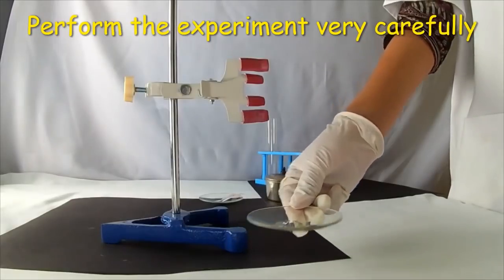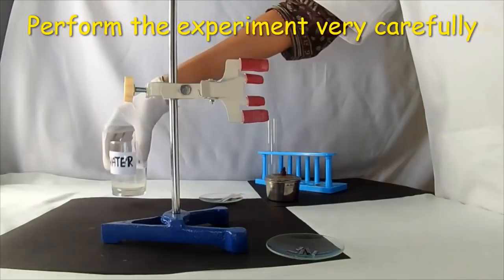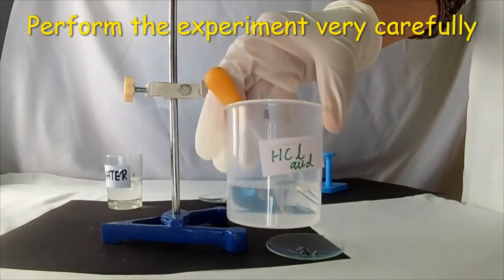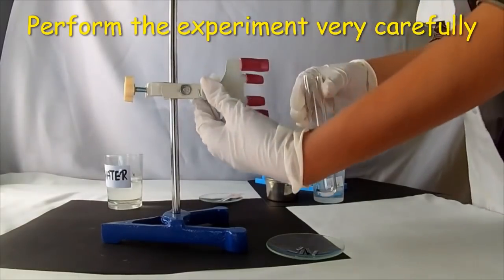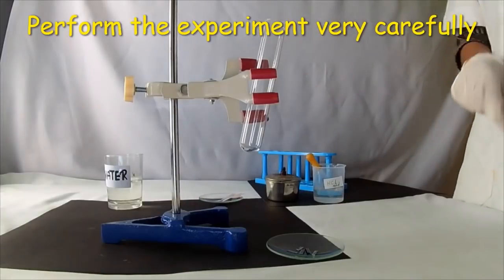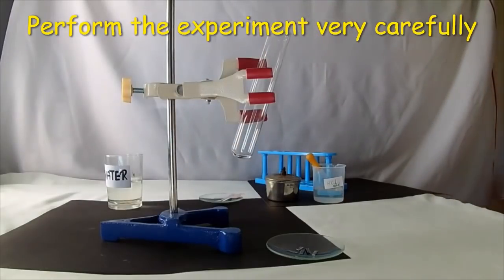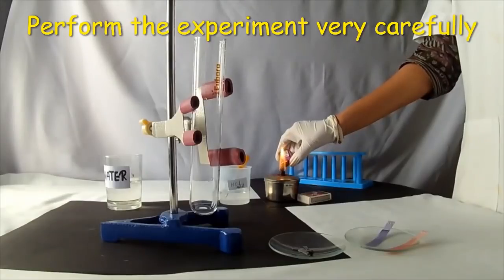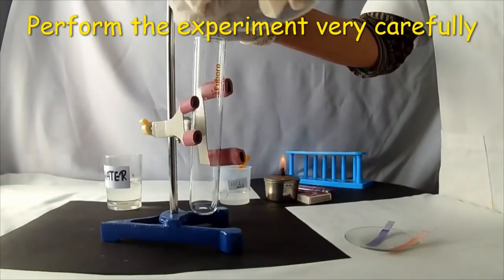Here are the magnesium pieces and dilute hydrochloric acid. Take the test tube and fix it to the iron stand — be careful. Adjust the test tube properly and light the spirit lamp. Deliberately add the magnesium pieces into the test tube.